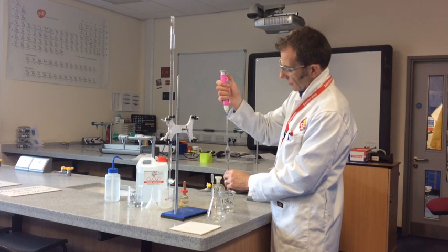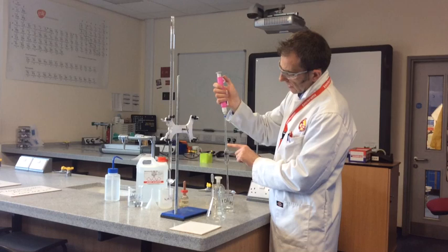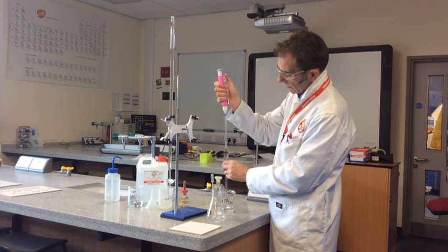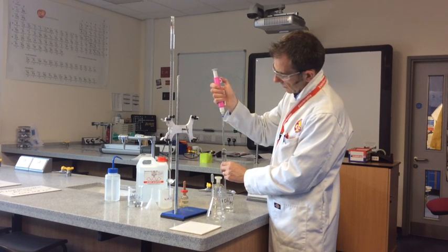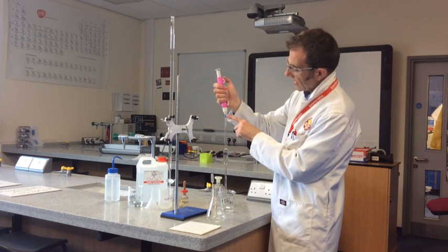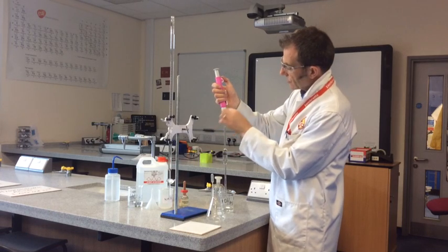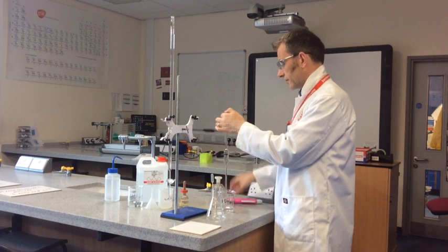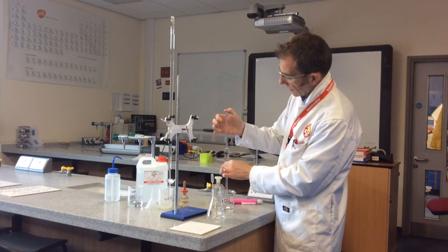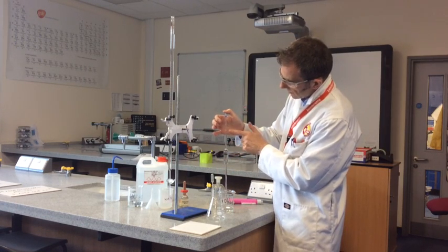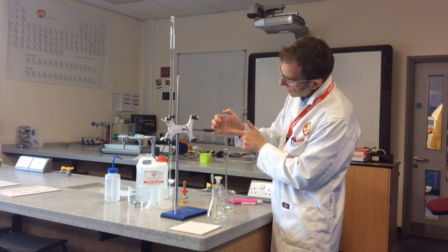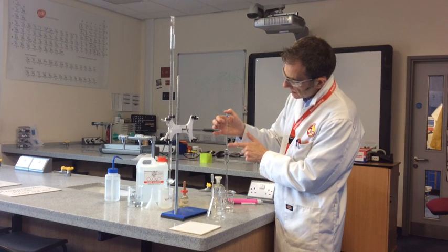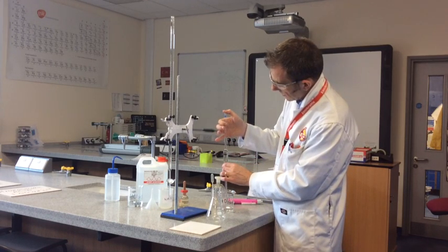We're coming up to the potentially tricky part now. The zero line's there, I'm going to run it to about there. So here we go, and what I need to do is get this off quickly and get my thumb over and stop the meniscus. So my thumb will control the meniscus. I'll just put it under that hand so you can see a bit better. So the zero's there, the meniscus is there at the moment. Using our thumb very carefully, we're running the meniscus down so that it sits on that line. We'll do that now.